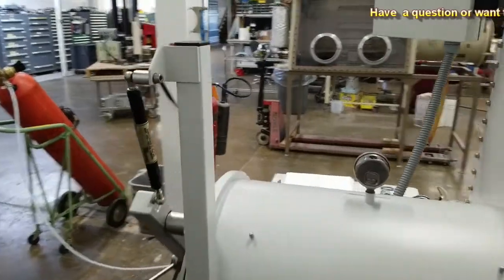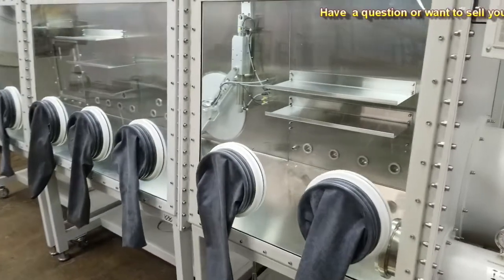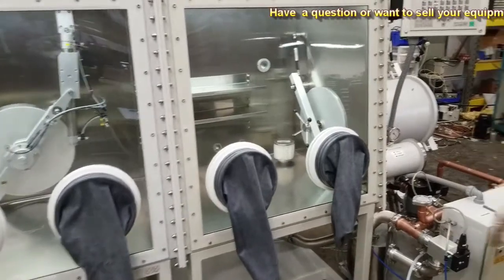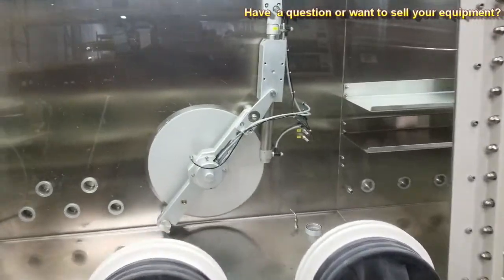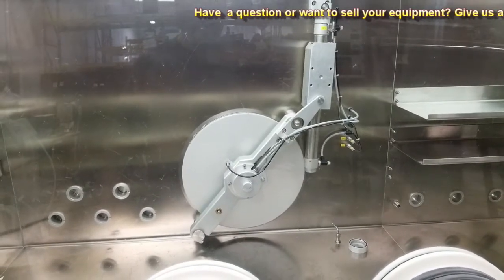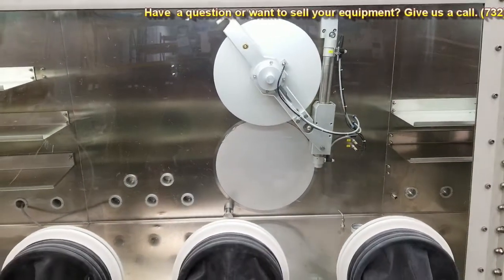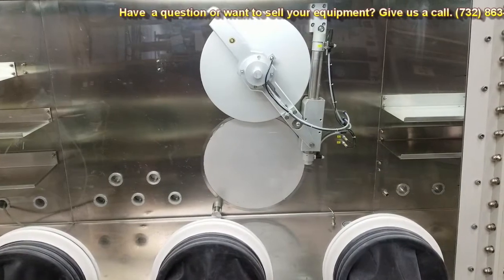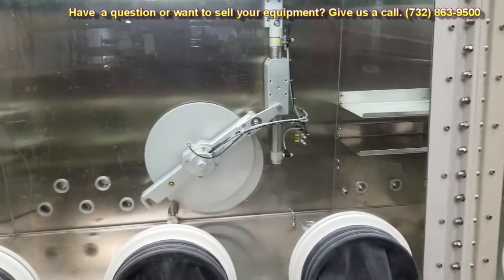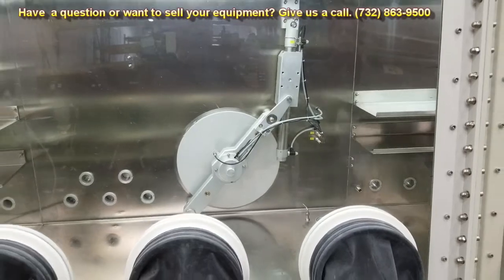So we'll go around the front and open and close that inner door. If you watch the inner door, I'll just hit the switch here that says inner door in chamber 2. You see it backs out and it lifts up. Now it is sealed from the back side, so it should be alright. Shouldn't cause any problems when you open and close it. And we'll go ahead and close it. Come down and it'll push close. Okay, so you can see that that's operational.